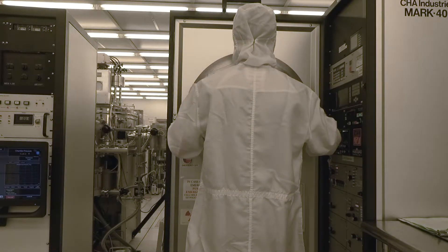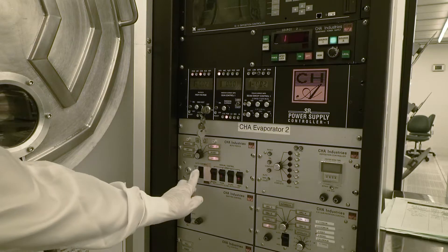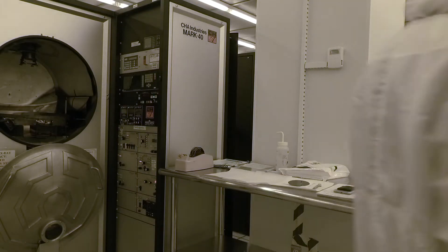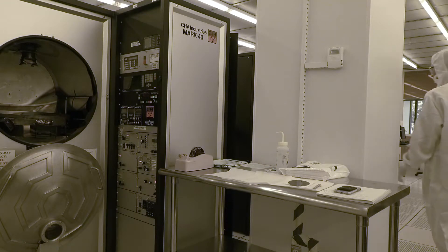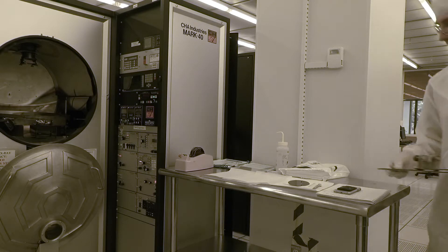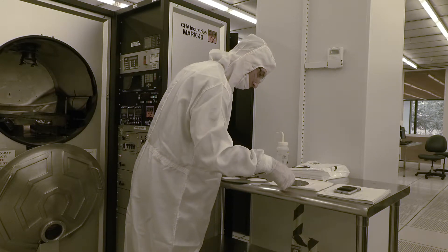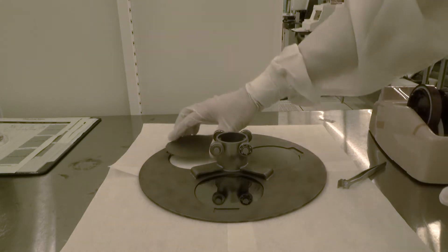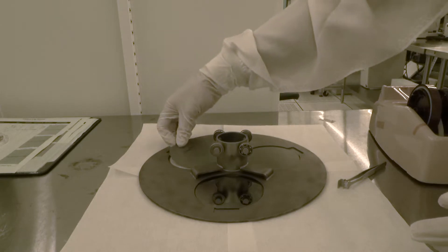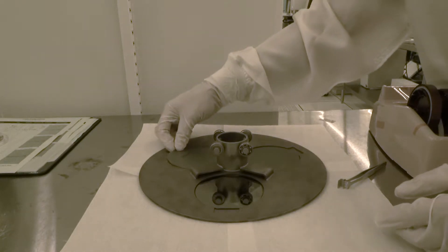When the chamber is finished venting, gently pull the chamber door towards you and then slide it down to its resting position. Move the rocker switch on the Autotech 2 controller back to the standby position. Place the sample tray on one of the nearby stainless steel tables. When loading a sample onto the tray, make sure you place it face down. The bottom side of the tray will be the side exposed to the evaporation source. Make sure the flat edge of each wafer is aligned with the recessed area on each wafer cutout to ensure the evaporated metal is distributed evenly.